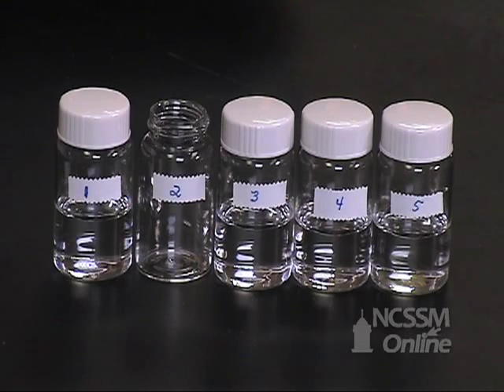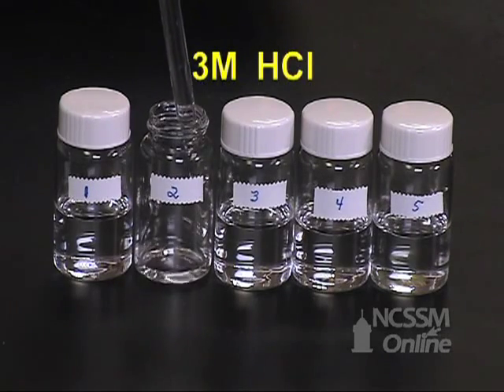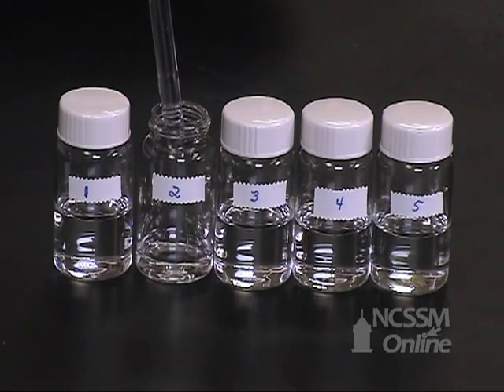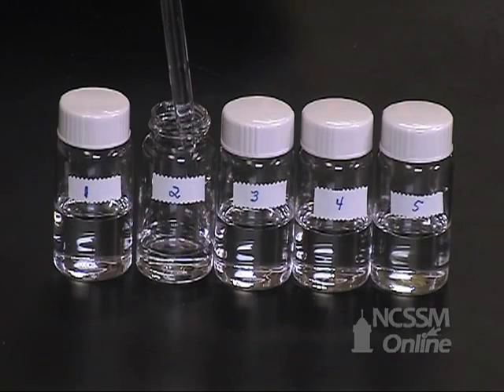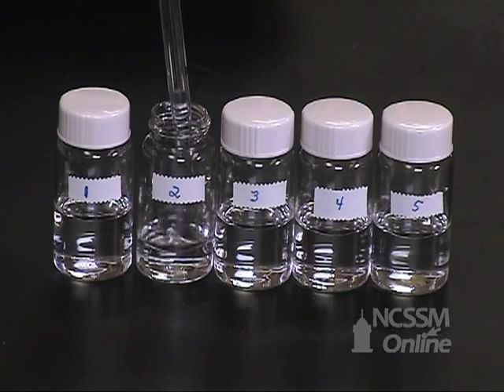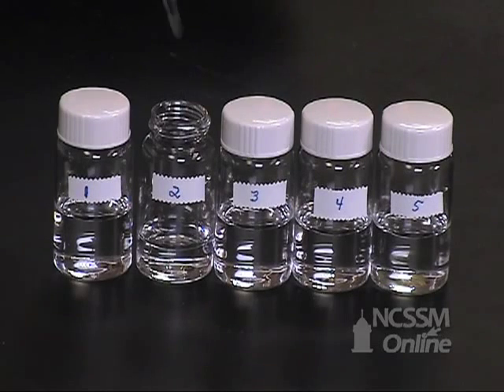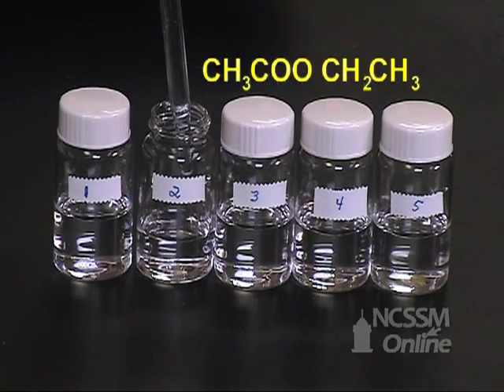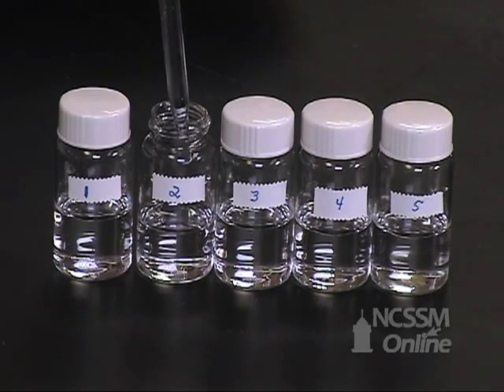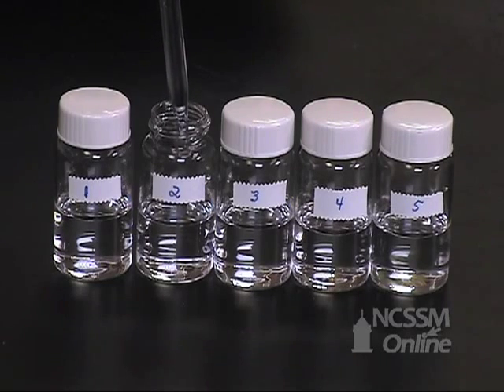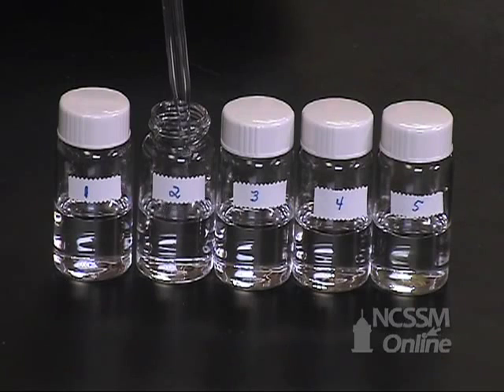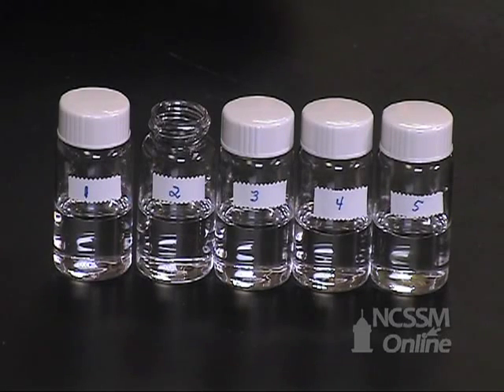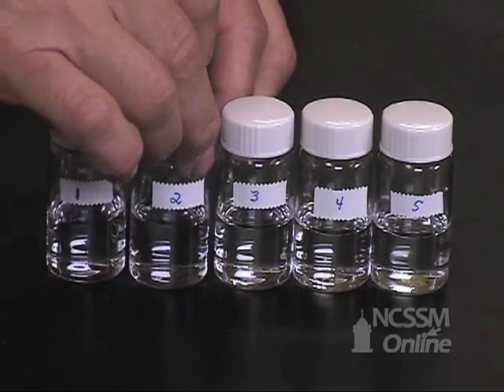we will pipette 5 mL of 3-molar HCl and 5 mL of ethyl acetate. Cap the vial.